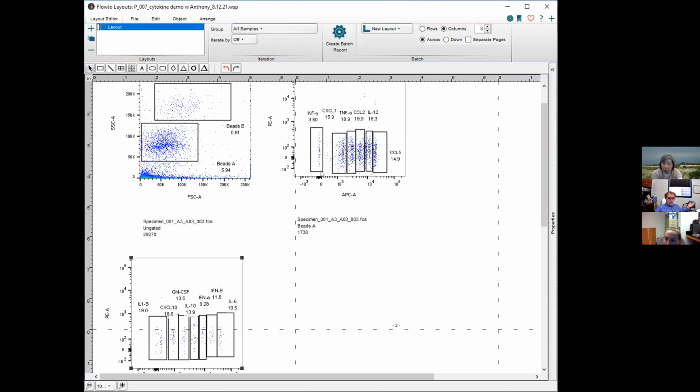No, each one is a different cytokine. Yeah. No, I'm saying, let's take interferon gamma. This vertical spread, some beads bind 10 to the -2, some beads bind 10 to the 2. You put a sample in with a certain amount of interferon gamma, and what's the result? I don't think it's binding though. I don't think that's what this is. I think this is a signal of PE. I think it's the PE signal.